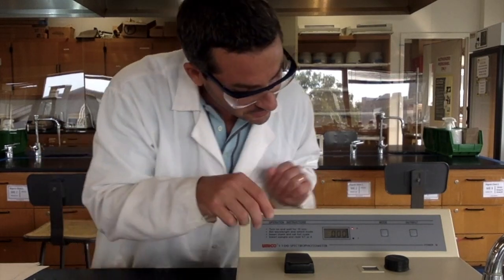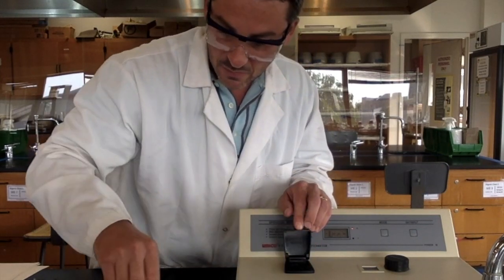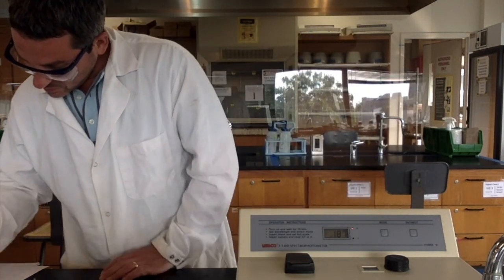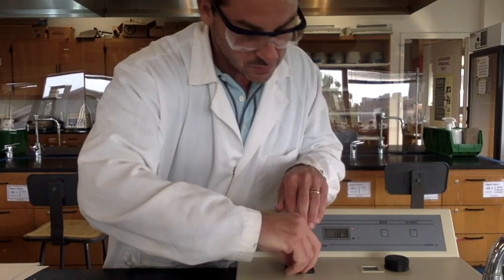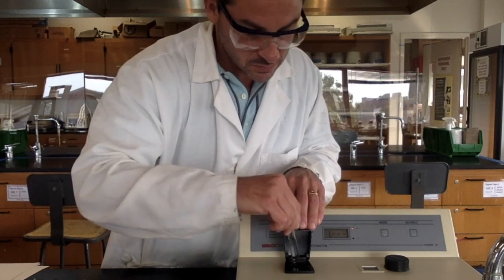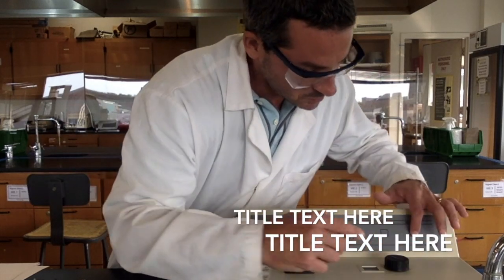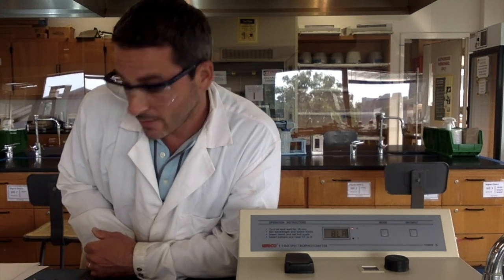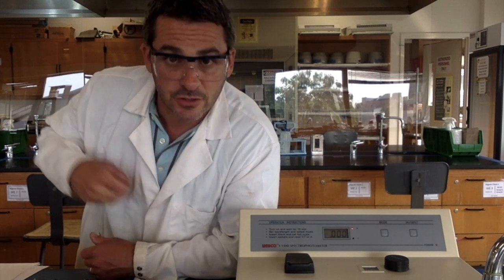The screen went blank there for a minute. All right, I think you can see where I'm going with this, so I will spare you the rest of this. I'm going to go up to 660 nanometers every 10 nanometers. This process gets a little redundant, so I don't think we need to follow my every move here. So you can join me back for step 2 when we're preparing solutions, and we're going to make the calibration curve.